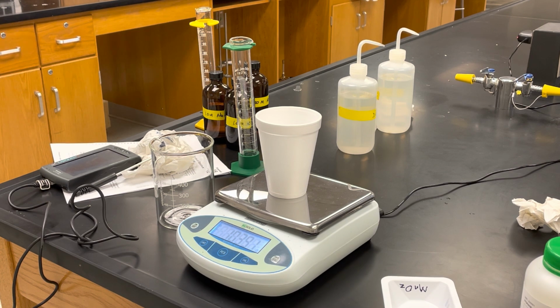Reaction 1, all the data. Reaction 2, reaction 3. Label all that data clearly and concisely, making sure to include the concentrations of your solutions. There will be a part 2 to this video where we're in class and we talk about the calculations that need to be done. But all virtual students need to have the complete data table with all of this on here.